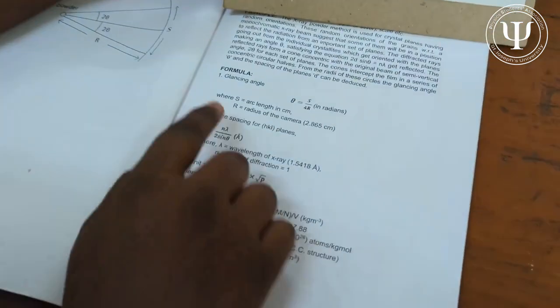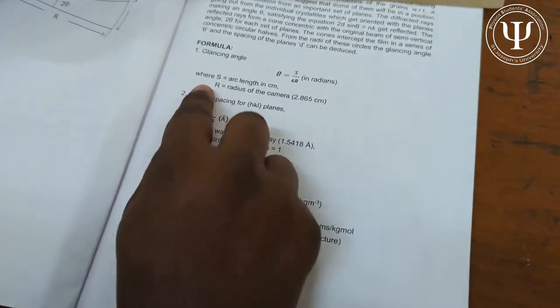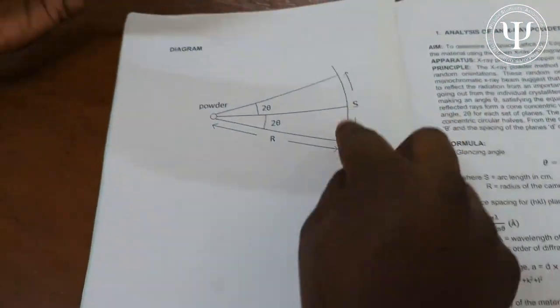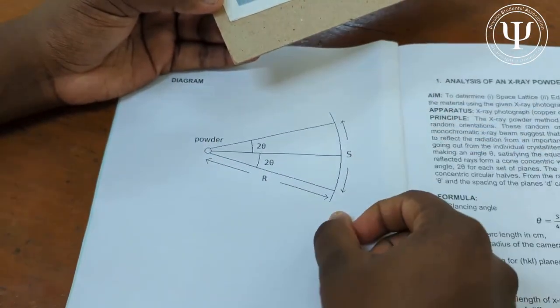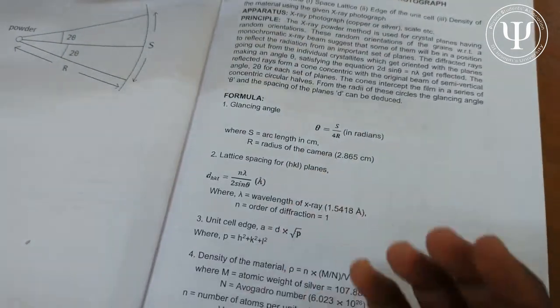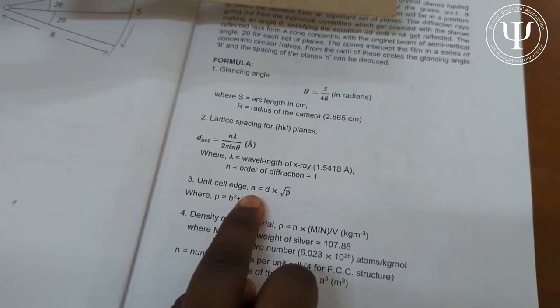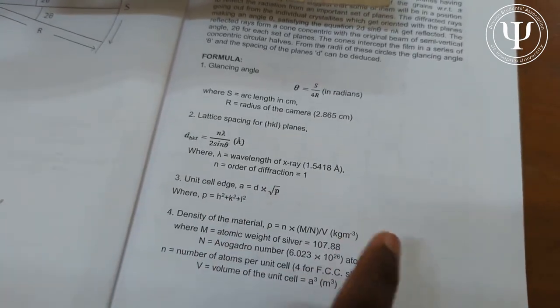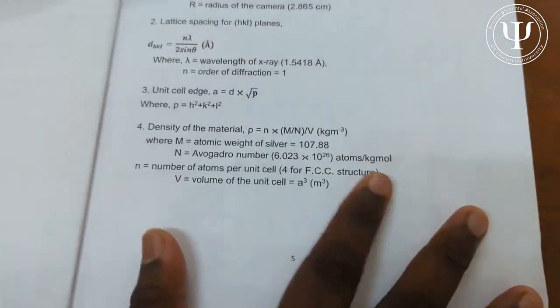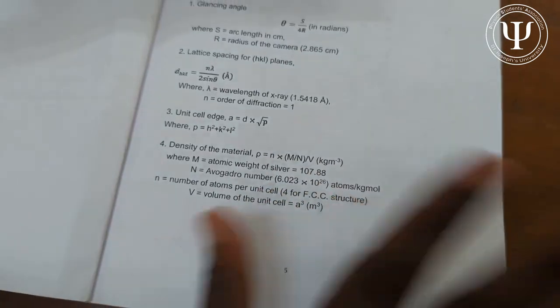The formulas are simple. The glancing angle is θ = s / 4r in radians, where s is the arc length in centimeters and r is the radius of the camera. For the lattice spacing of the hkl plane, the interplanar distance is d = nλ / 2sinθ. The edge length of the unit cell is a = d × √(h² + k² + l²), and the density is ρ = nM / N_A × V in kg per meter cubed.